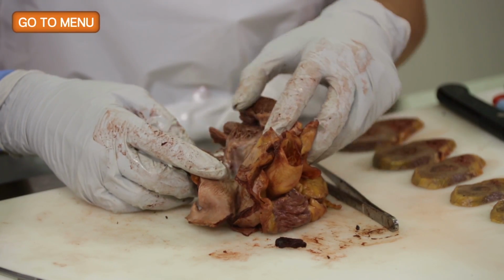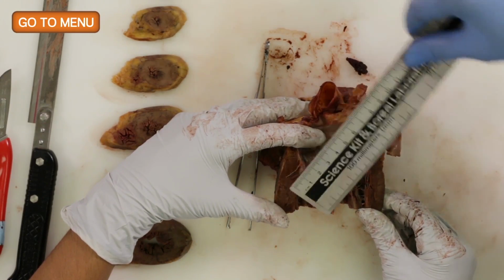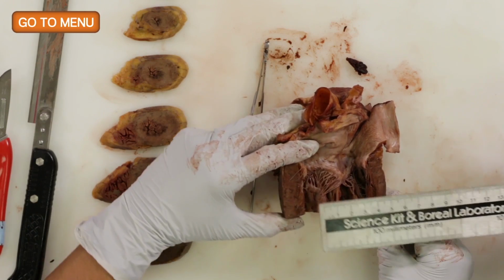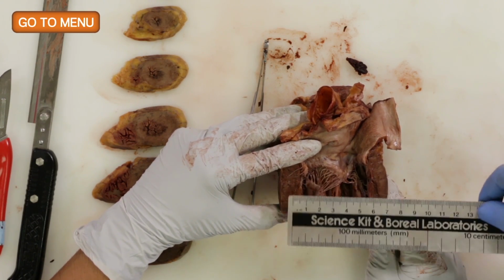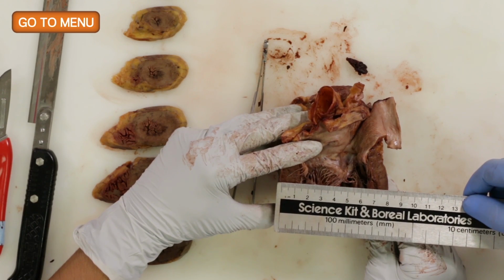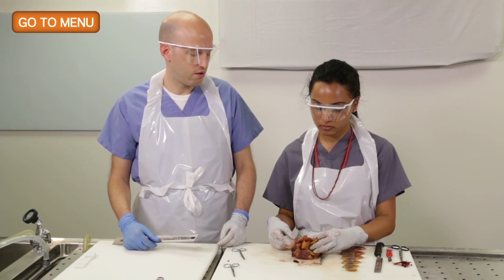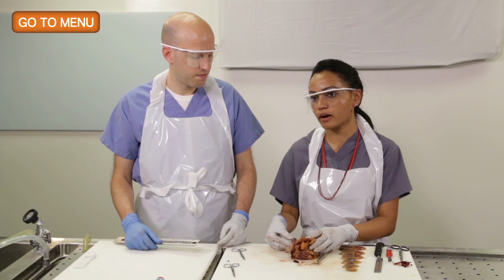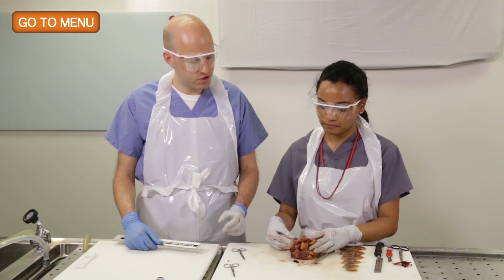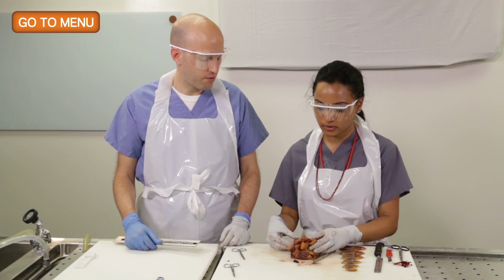So you can see the mitral valve. You can measure about 1 centimeter below. And then the one thing you want to pay attention to is you don't want to measure the papillary muscles, and you don't want to measure the epicardial fat. So if you measure here, we're looking at about 1.4 centimeters. So is that a normal left ventricular thickness? Yeah. Anything less than 1.5 is normal. Right. Generally between 1.1 and 1.5. So 1.4 is a normal thickness.